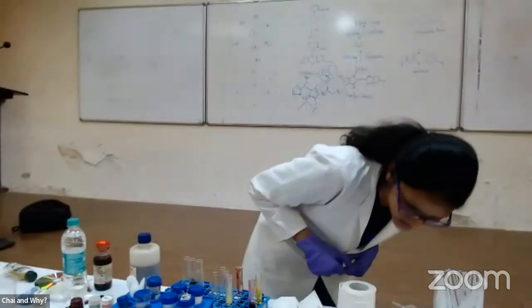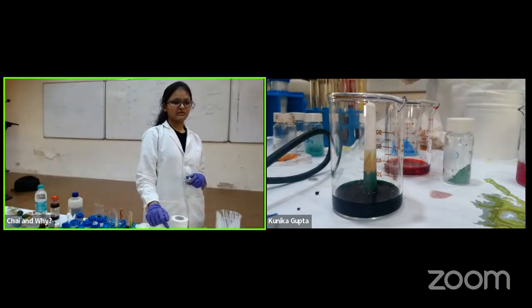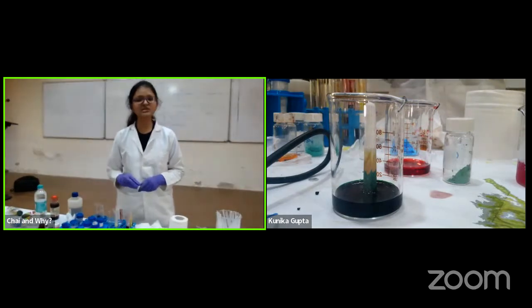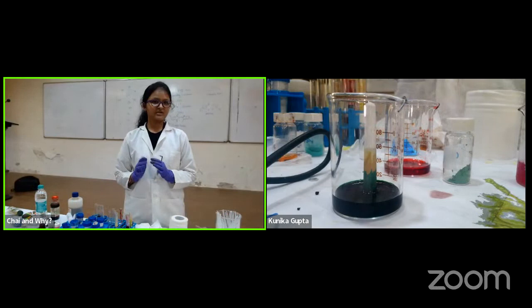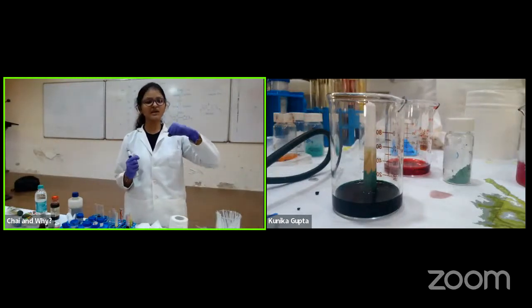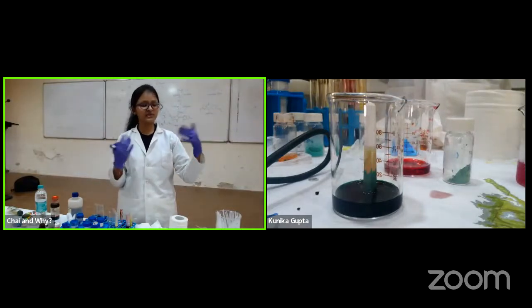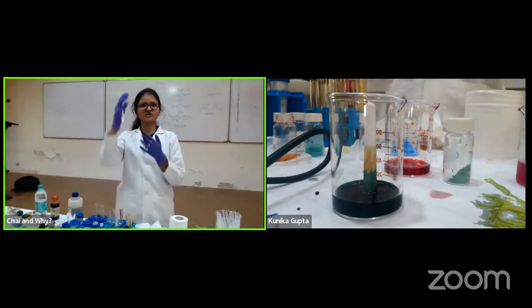Okay, so again you can see that now the yellow is mixed slightly with red. Now this is something interesting, because two things can have a similar speed even though not equal. I know yellow moves faster than green, but red can be somewhere in between. Right now there's no overlap visible with green because they are dark colors, but with yellow you can see it, and we can eventually face this problem with my reaction as well. When I put it in the column, two things will move together.